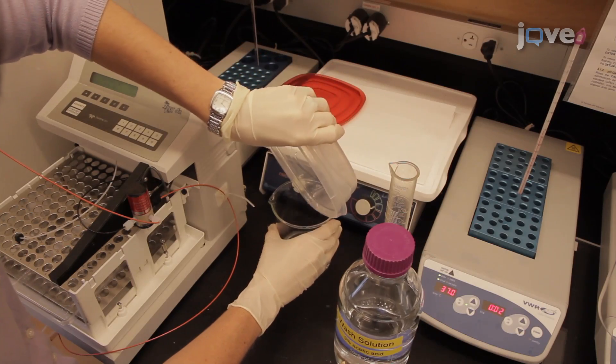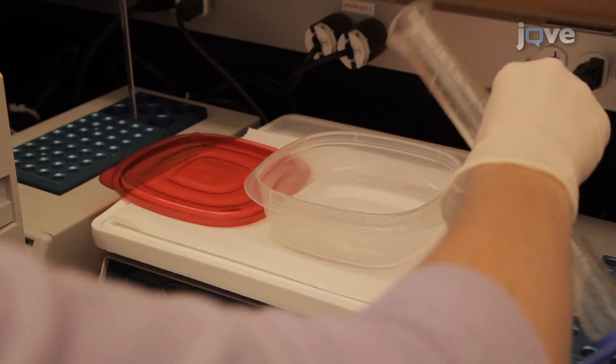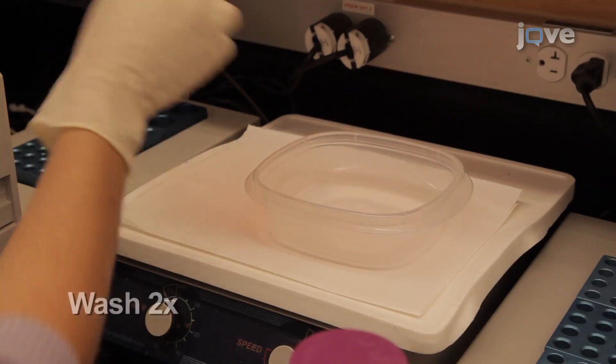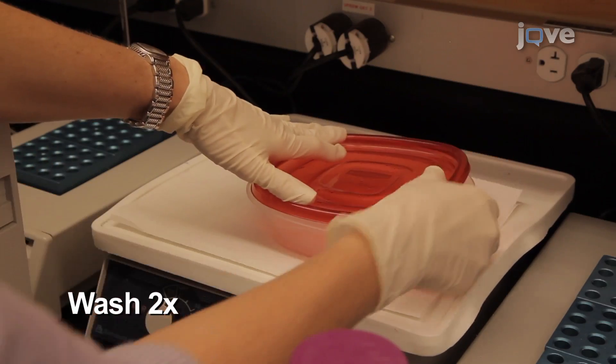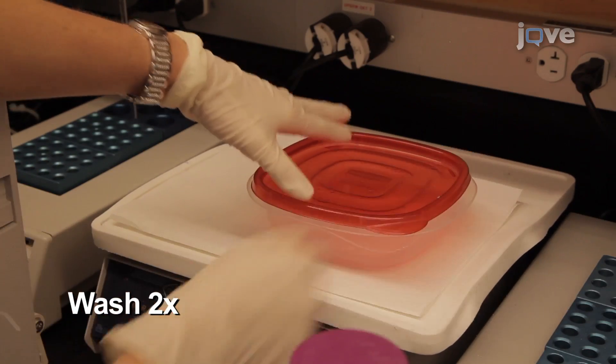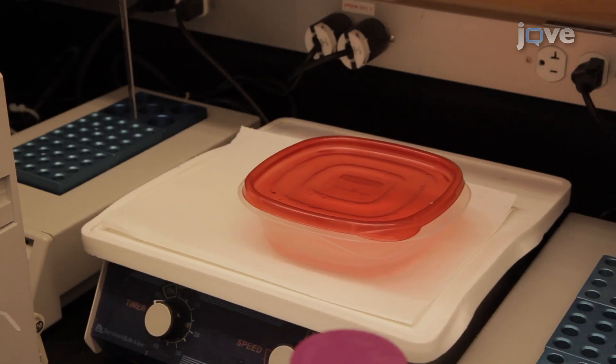The following day, wash the gel with 100 milliliters of the prepared wash solution for 10 to 20 minutes at room temperature with gentle agitation, repeating the wash a second time with fresh wash solution.